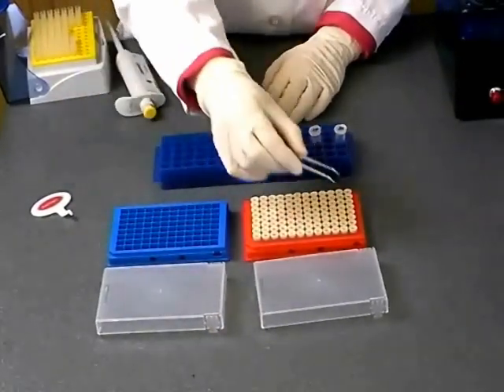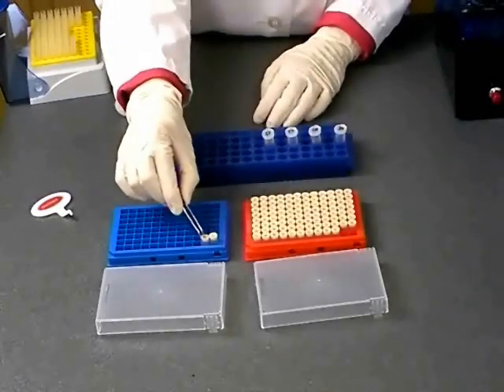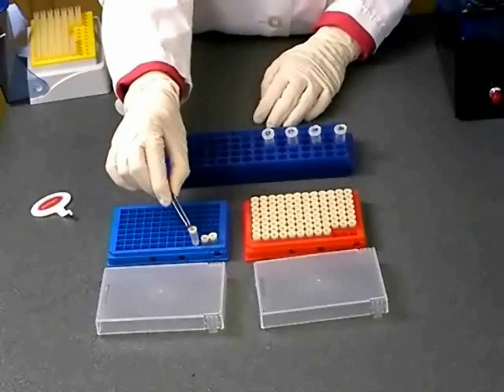Using forceps, transfer your desired number of Gentegra DNA tubes to your working rack. In this case, we will do four samples.